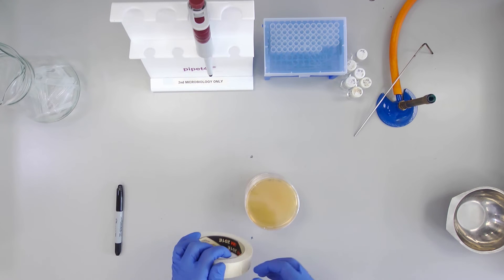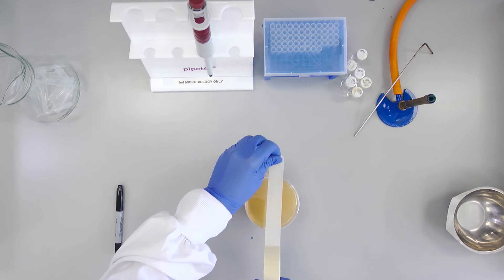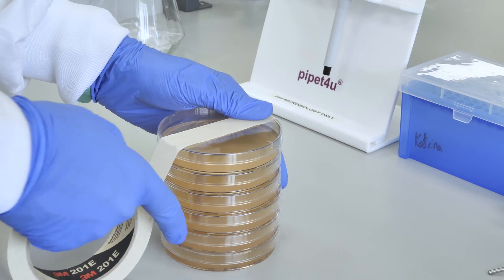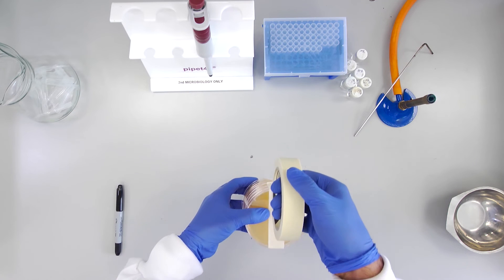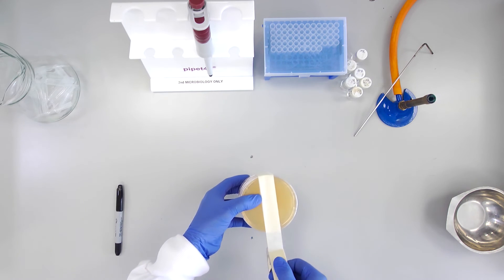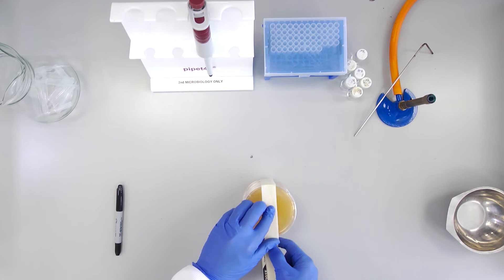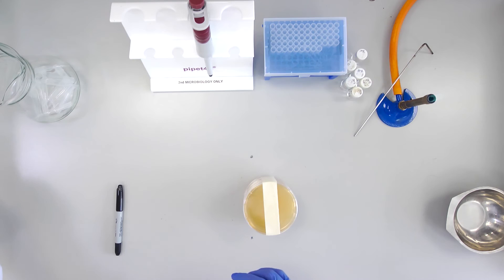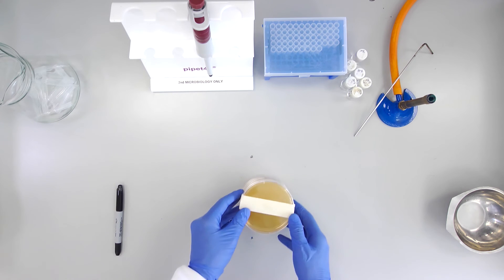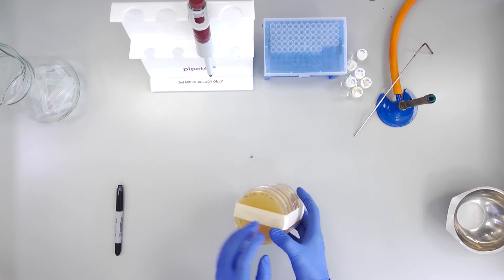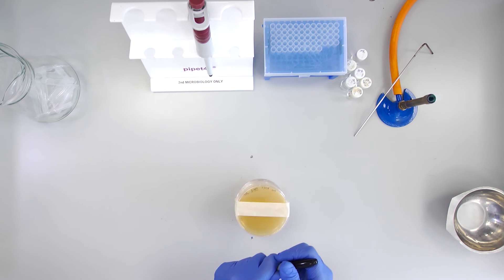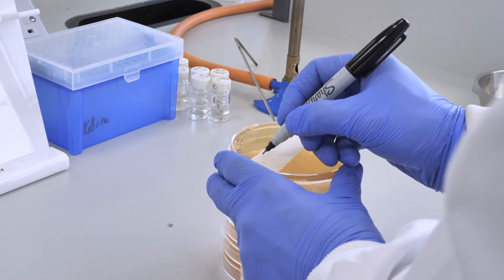Once all plates are inoculated and spread, they will be incubated at 37 degrees Celsius for 24 hours. Make sure that your plates are securely wrapped and can be identified by name or initials and date.